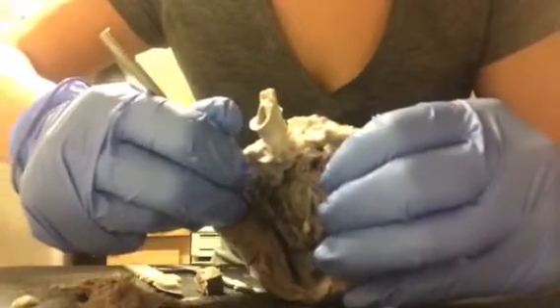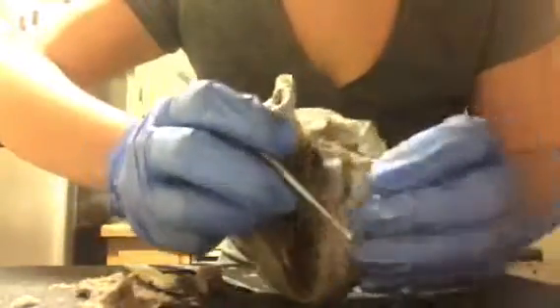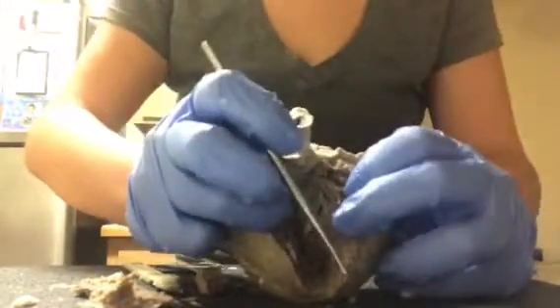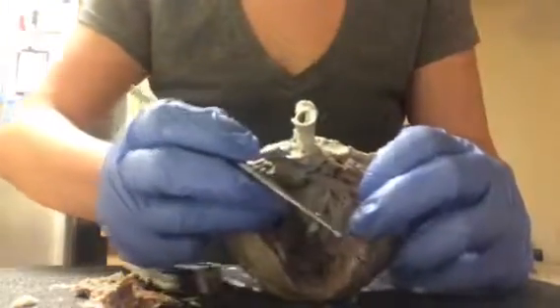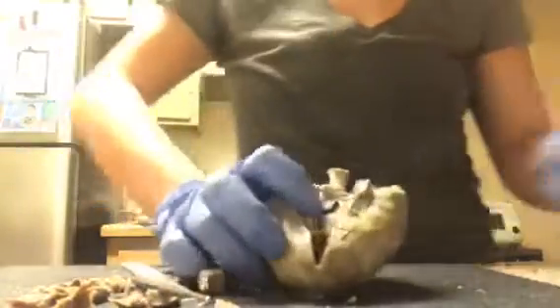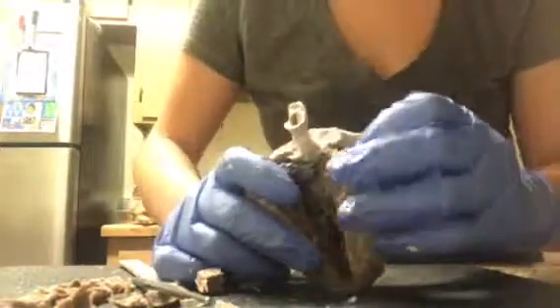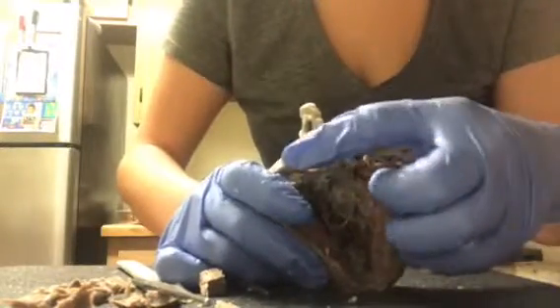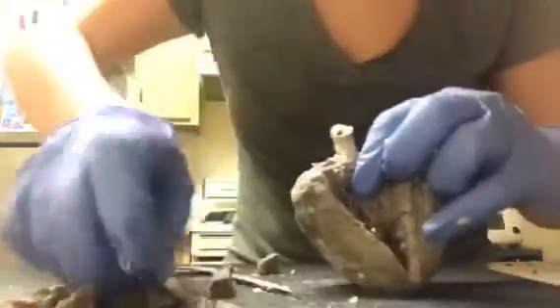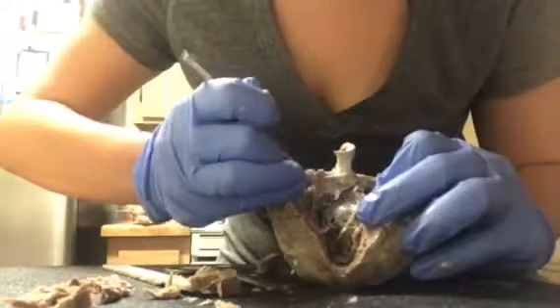It's a little dark to see inside. I don't have the greatest lighting. And then on this side, this is actually the left ventricle wall. So it would be the same thing opposite to find the right ventricle, which would be over here, with the right ventricle wall over here. Also, the left auricle would be right up here. Sorry, left would be on this side. And then the bicuspid valve is actually right here now that I can see it. It's right up here.